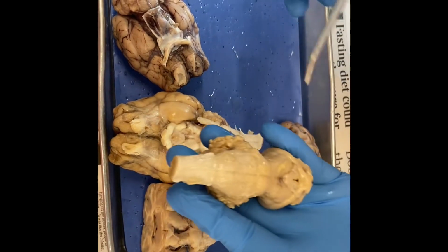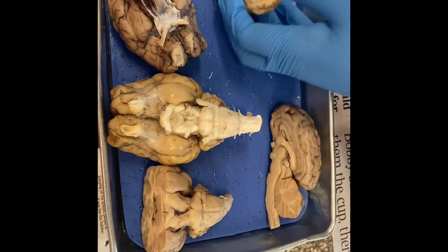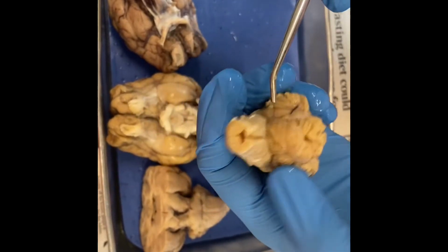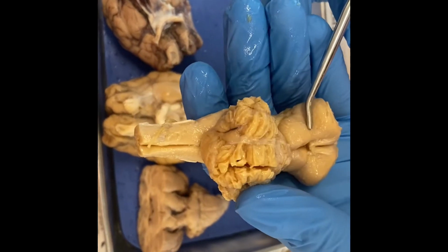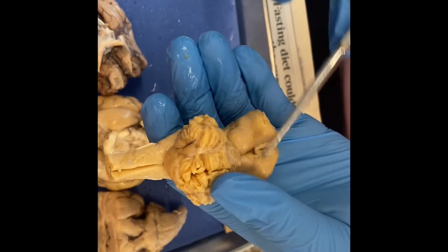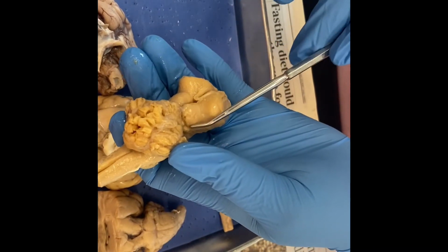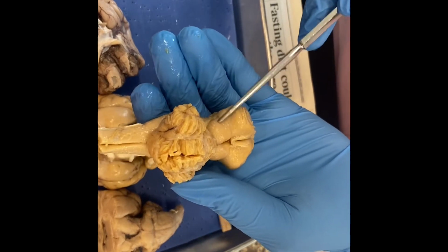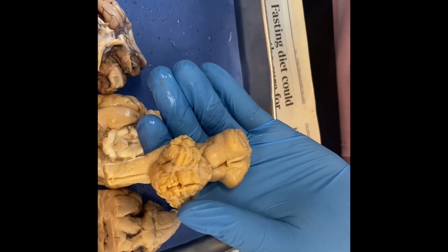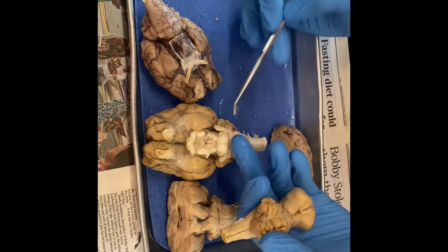And then I'm going to go back up. So when you go back up here, we also have our, sorry, give me 1 second. Which one were we looking at to see it? Literally this one. Okay, so we go back up. This is going to be our corpora quadrigemina, so it'll just be the quadrant of it. So we have two superior, superior, superior. Go down, we have an inferior and an inferior colliculi. So inferior colliculi, superior colliculi, superior colliculi, and they are going to be a part of the corpora quadrigemina. And then these are our cerebral peduncles right here.